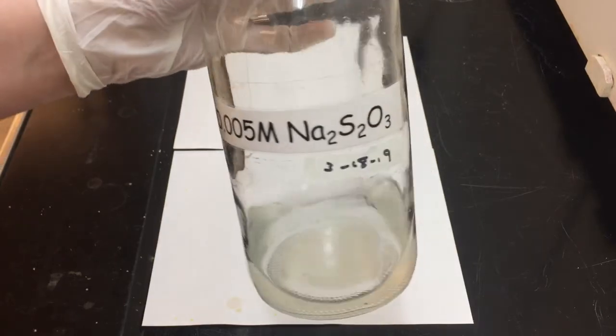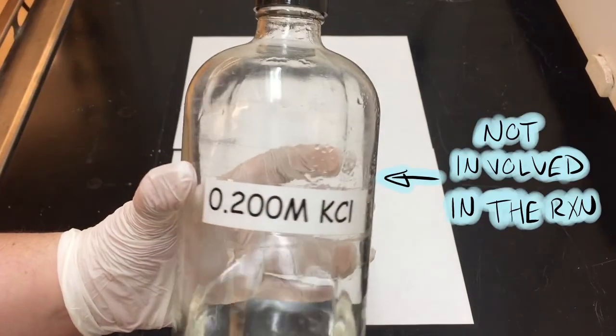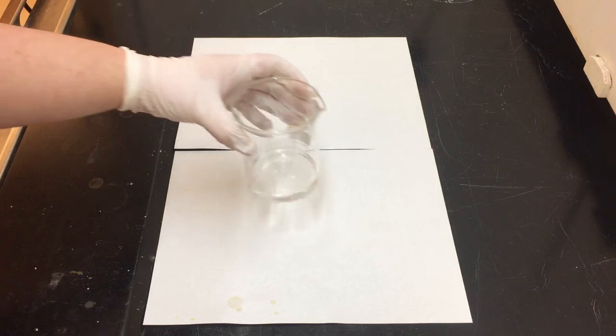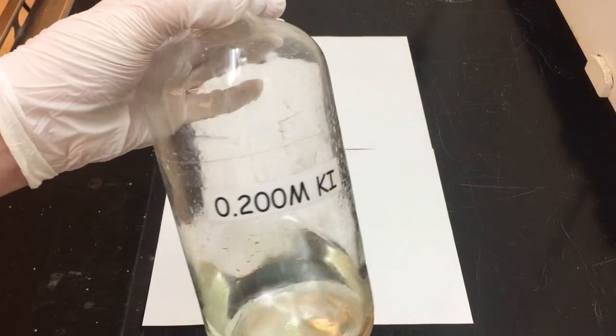All right, so we're going to have the exact same chemical setup. We're going to grab some of that S2O3 2- and some more of our starch, and we're going to place it in a beaker alongside some KCl. So this KCl is not explicitly involved in the chemical equation, but it is going to help to make up some of the volume difference and balance up the number of ions in solution.